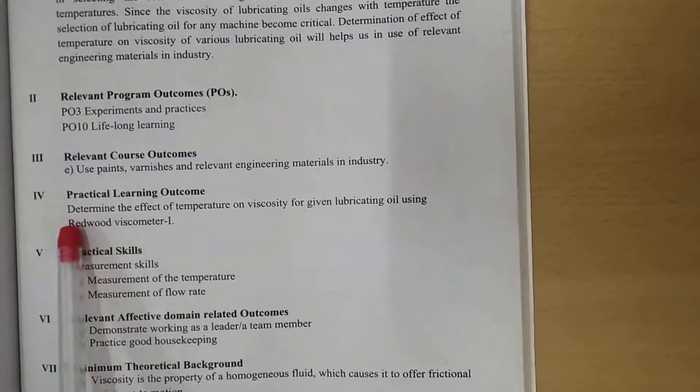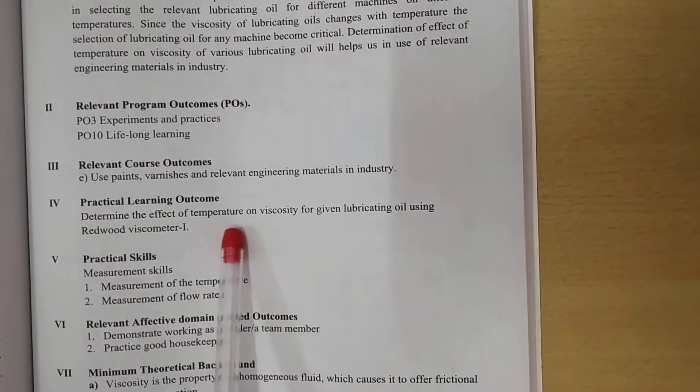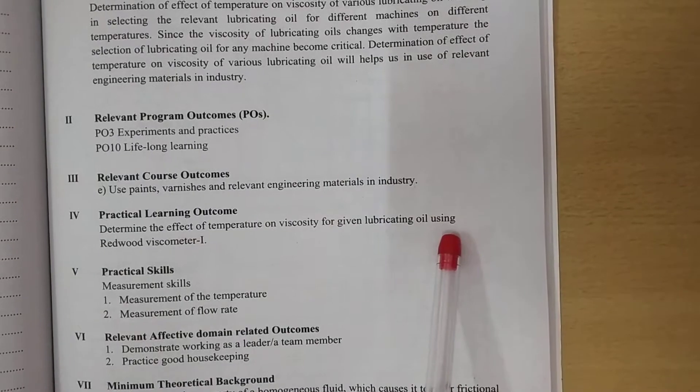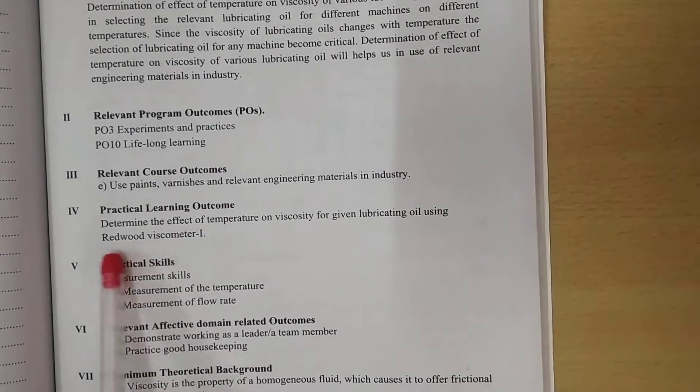What is the practical outcome? Determine the effect of temperature on viscosity of a given oil lubricant using the Redwood Viscometer.